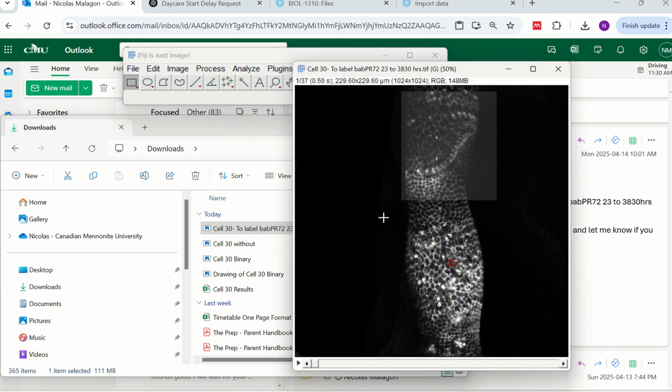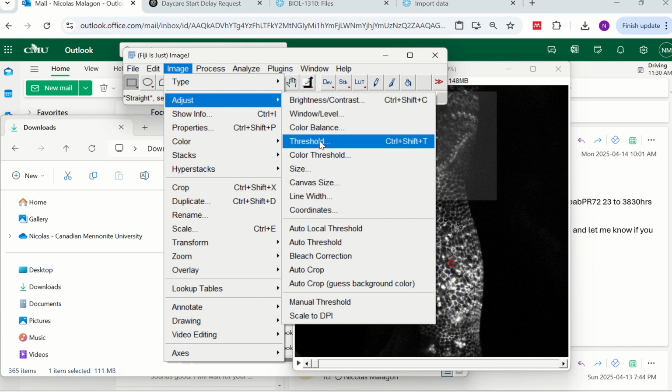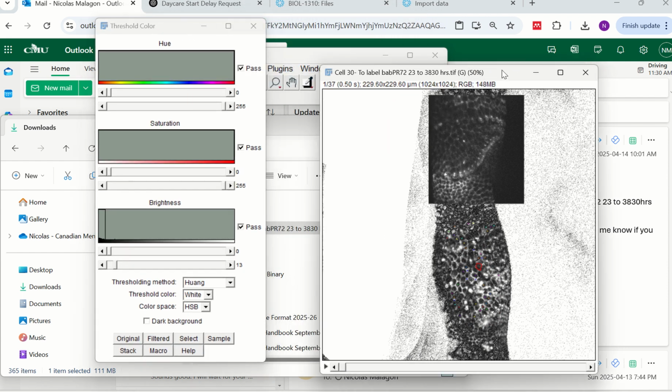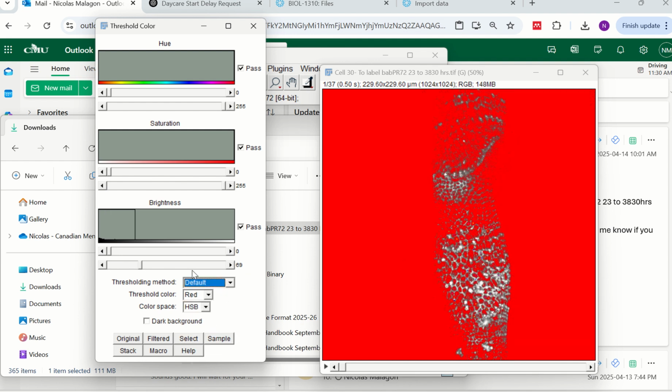Now, the next step is we need to remove all the white and keep the red. And it's pretty easy to do. We are not going to do it by splitting the channels. We are going to do it by going to Adjust, and then Color Threshold. The idea is that we need to remove only the white. Here below, if you have red, there will be only red. It doesn't make a lot of difference, you can have it in red in the threshold method here on the top. I will show you in a second why. Threshold color is the one that is important.